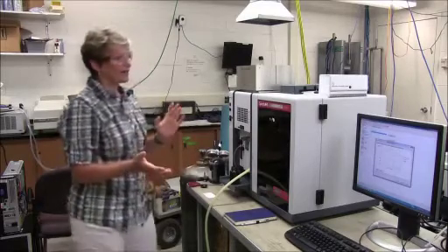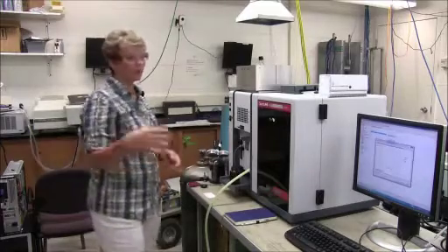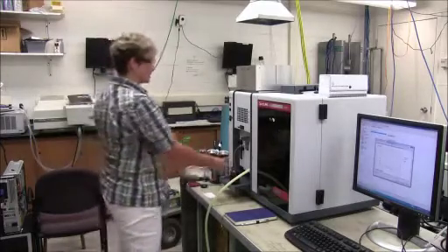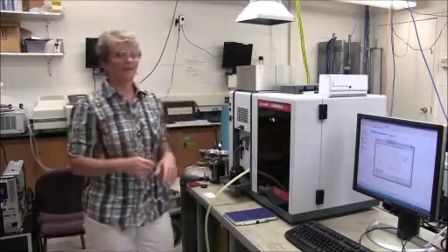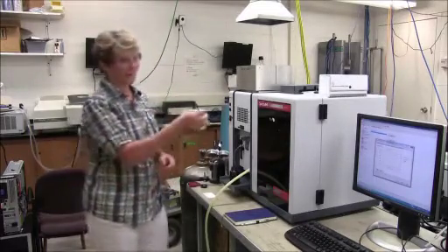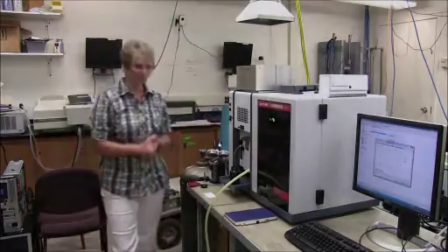And it will be very clear to you whether you've done a proper job on your standards. Once you've got that nice linear calibration curve, when you put your sample in, your unknown that has that element, it will hopefully fall on that graph, and you'll be able to exactly determine, based on the absorbance, exactly how much of the analyte was in the mixture.